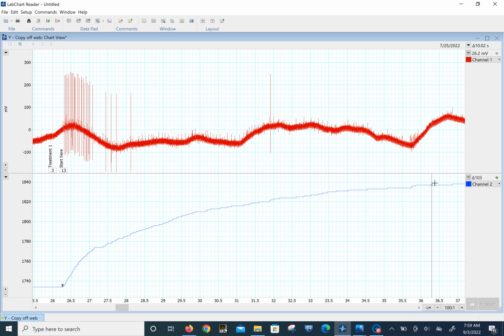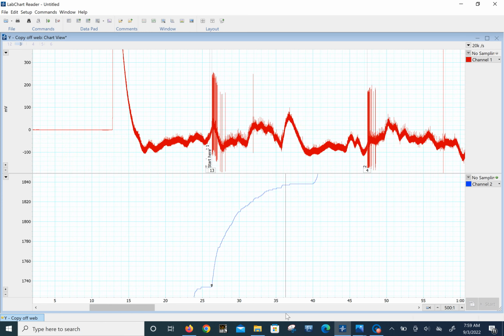Right there somewhere, we get 103. Okay, so either 27 large ones or 103 large ones plus these kind of larger ones that are out of the baseline. Now, if we scroll on over to, let's do the first one in this division right here and see what's happening.